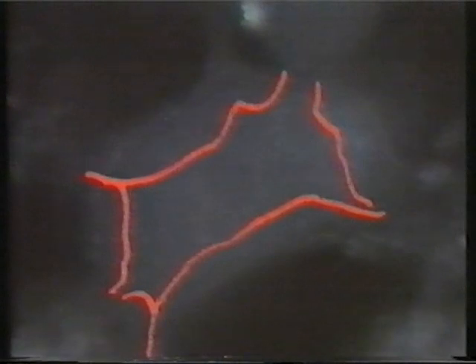When the xylene is added, there is a further considerable shrinkage and perturbation of the fluid round the cell, which goes out of focus. There are several shots of us here trying to refocus it. We now add DPX to embed the cell body, and we can draw the outline of the cell as it now appears. This is compared with the original shape and dimensions of the same cell body.